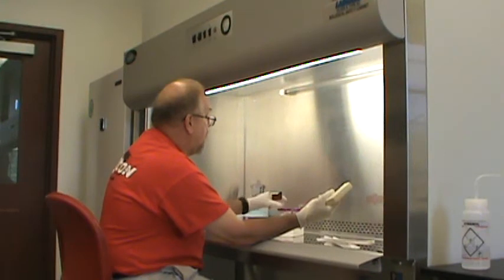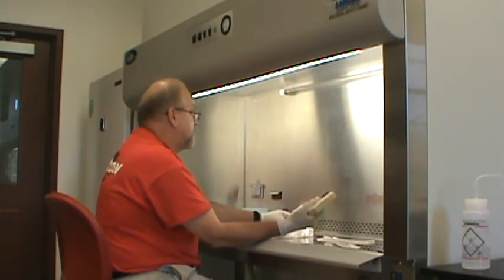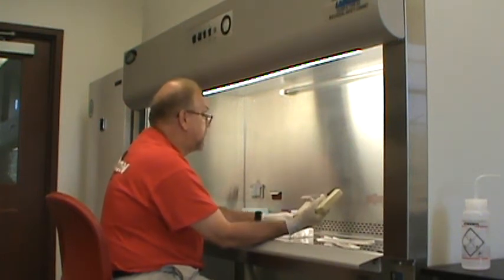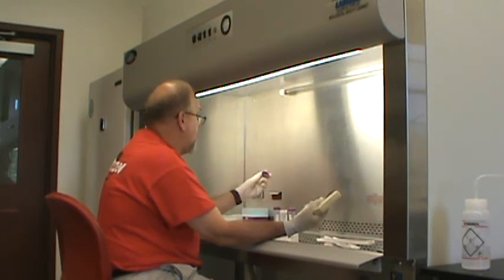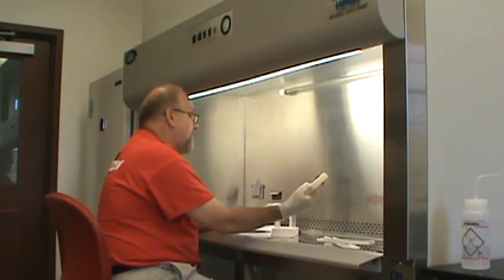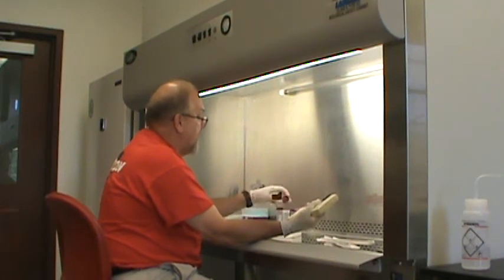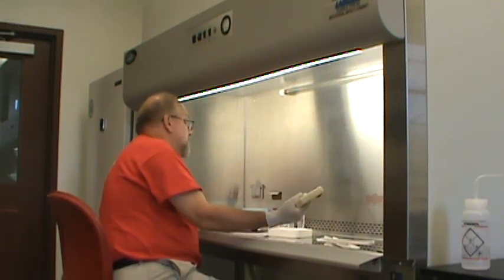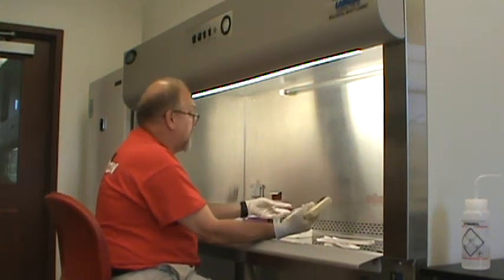Carefully put the lid on top of that. Go to the tube where we are going to put the sample, tip it to the side, and dispense the liquid. Then put the lid back on. In every situation, be aware that you do not want to get your hands above the lip, above the opening of the liquid that you are working with. You also do not want to touch the inside of the tube or the inside of the lid. Whenever you take a lid off, if you have to set it down, set it at the back out of the way or you will contaminate it.